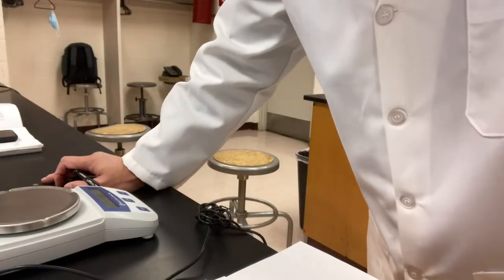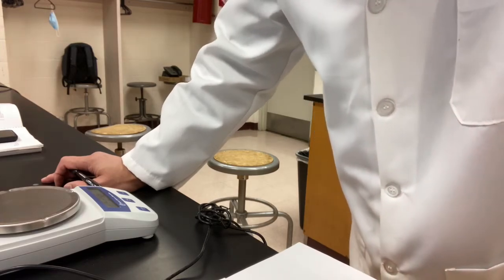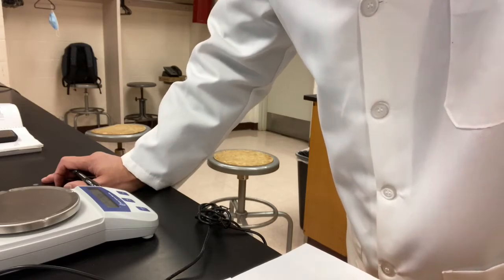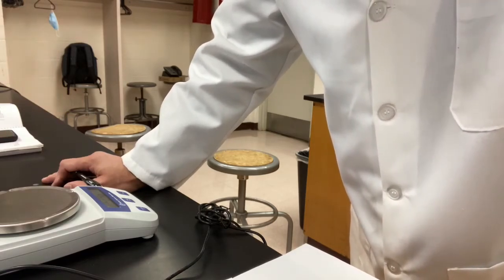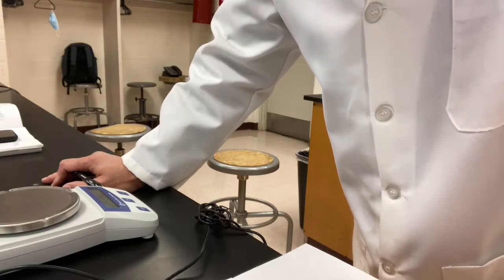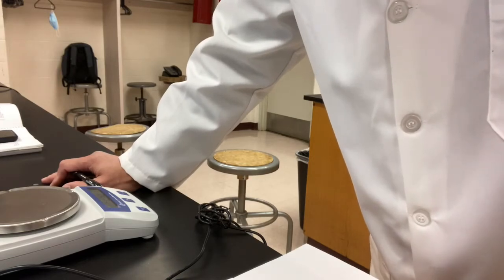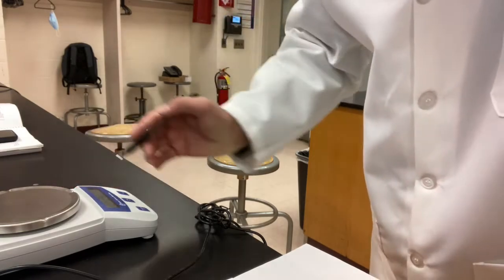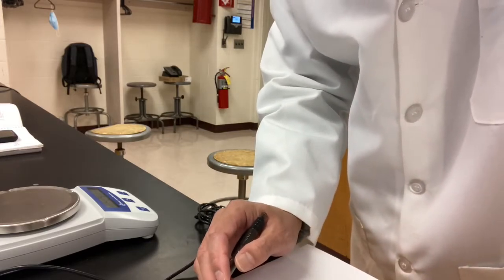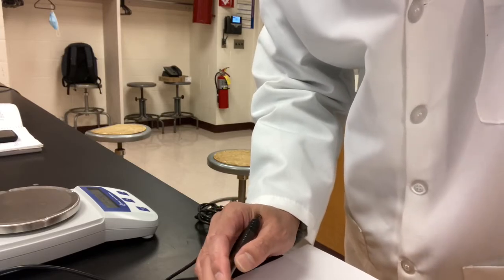I just did my trial number 2 for the unknown metal bead C. Okay, let me give you the data for trial number 2. The mass of the sample used this time is 20.18 grams. The initial volume of water is 5.10, and the final volume of the water is 7.40. Okay, that's another set of measurements of the beads.